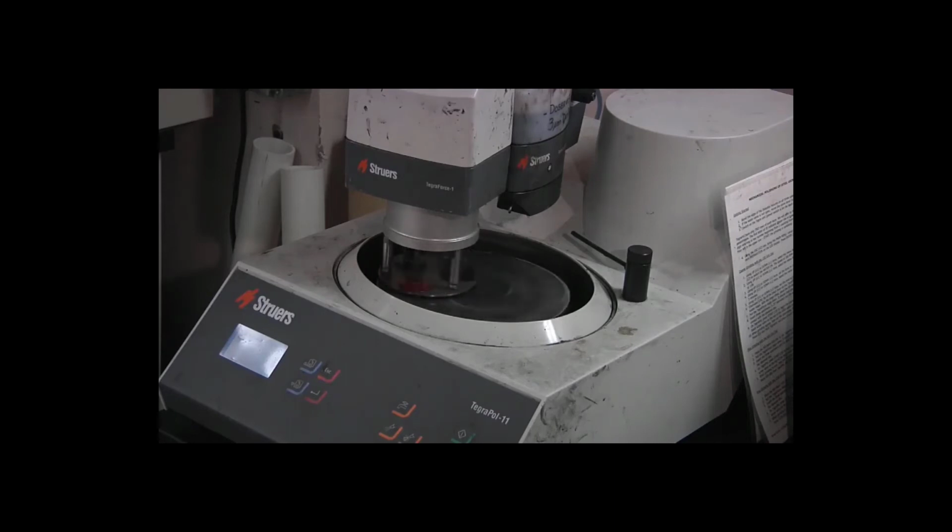But it needs to be that flat because when we do the microscopic hardness, the indent from the big hardness testers is either 4 to 6 millimeters for the Brinell or about 1 or 2 millimeters for Rockwell. The indent from the microscopic hardness tester is about 40 microns across, which is half the diameter of a human hair.